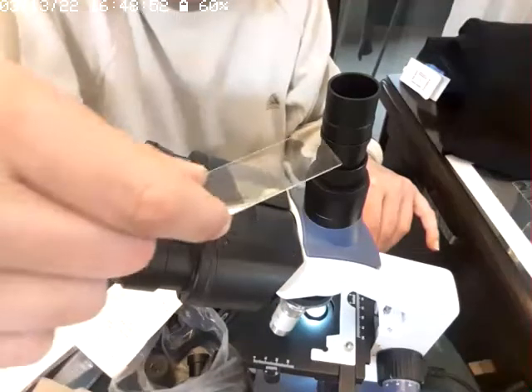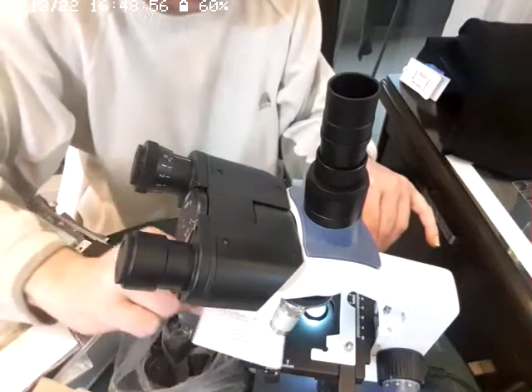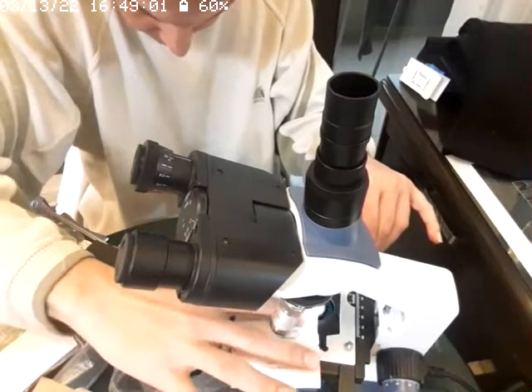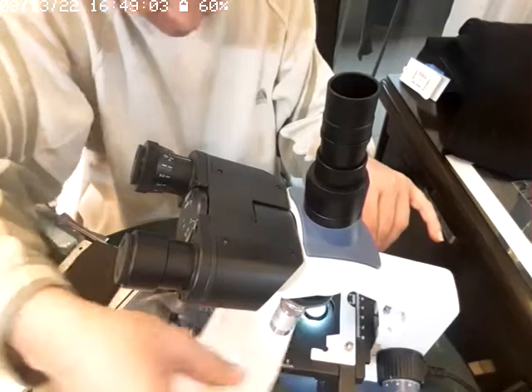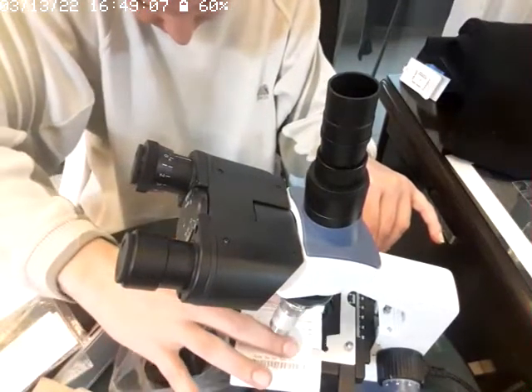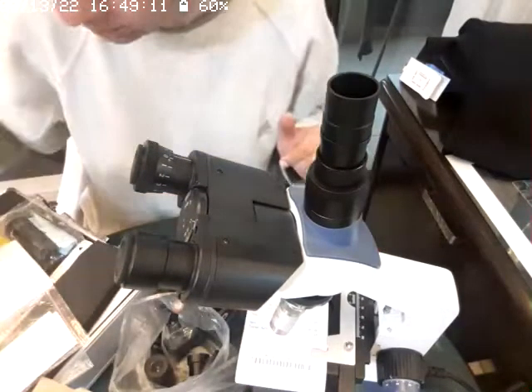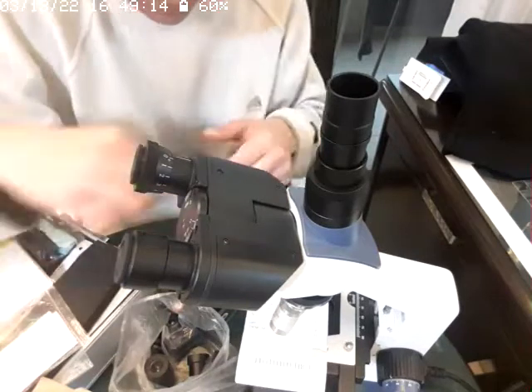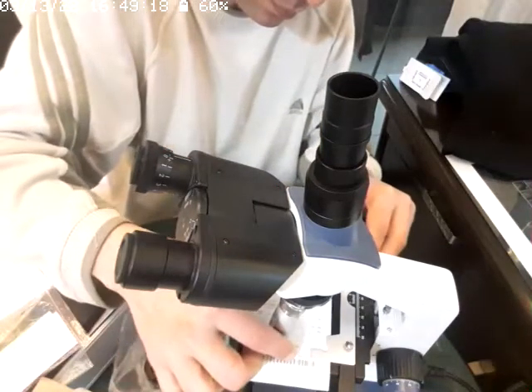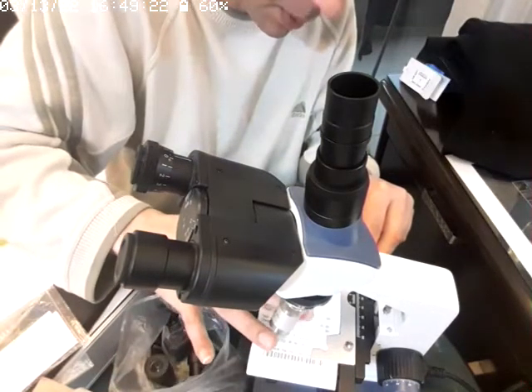This is the slide usually used, so I'm going to use this over here. Anyway, anything just to make it installed. Now I'm going to put this back again because I don't want to lose it. At least it holds the paper.